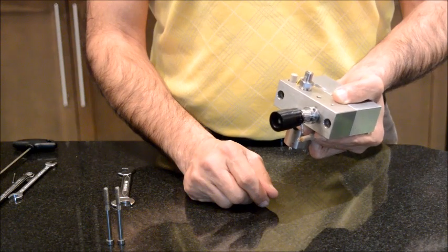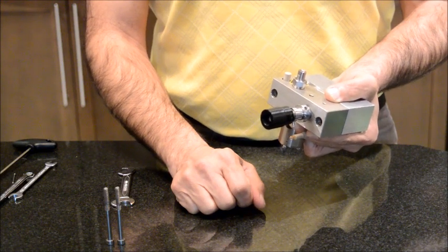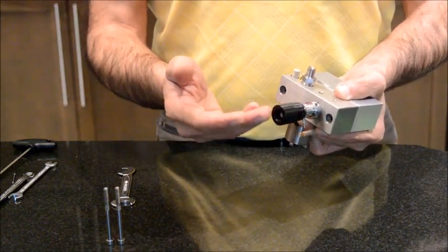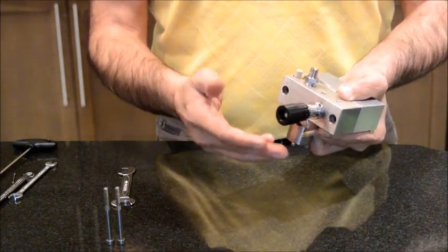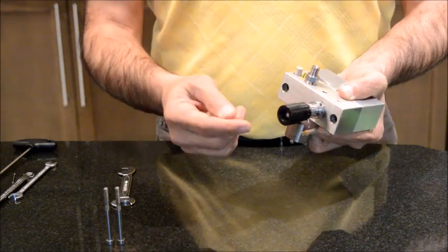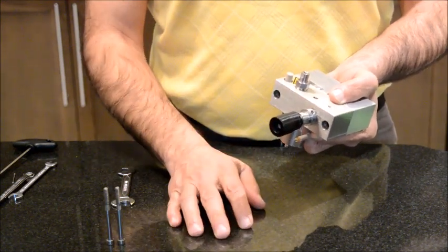Now, the problem that you may face that relates to this part is that you notice unusually high back pressure while you don't even have a column on the system. So let's say you remove the column and you see a back pressure of 5 bars, but now recently you're noticing, instead of 5 bars, something like 50 bars. And in some extreme cases, the pressure is so high that the pump shuts down. To fix it, again I will show you, we have to take this unit apart and replace the filter.